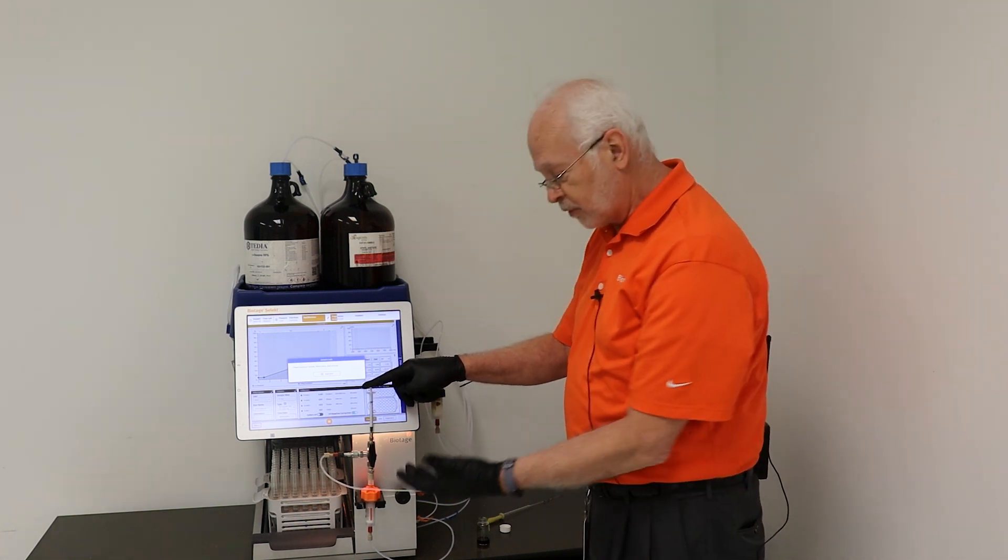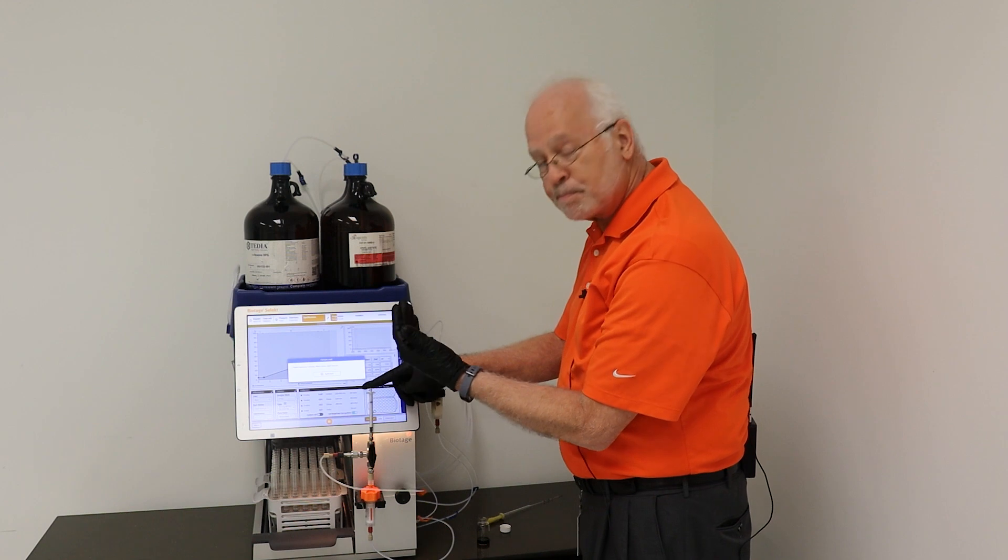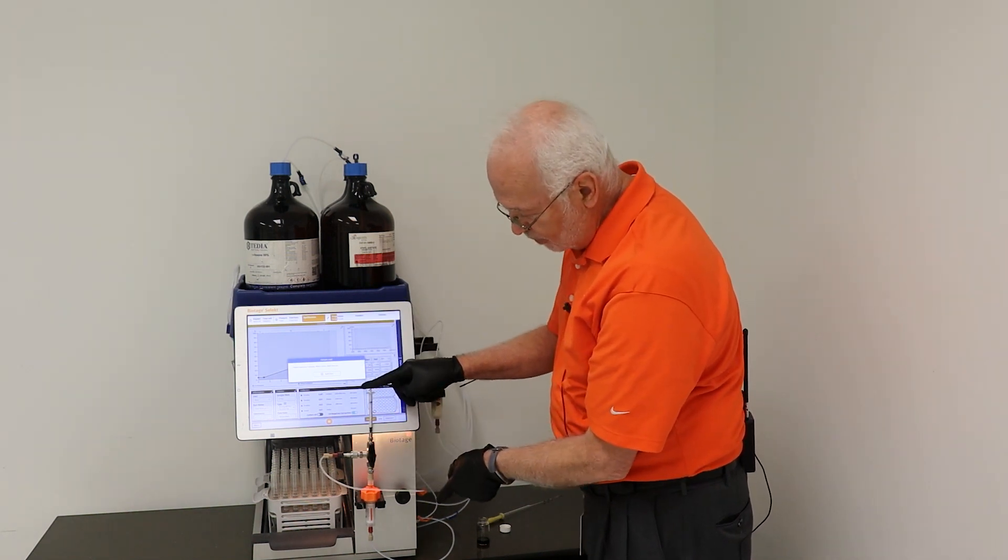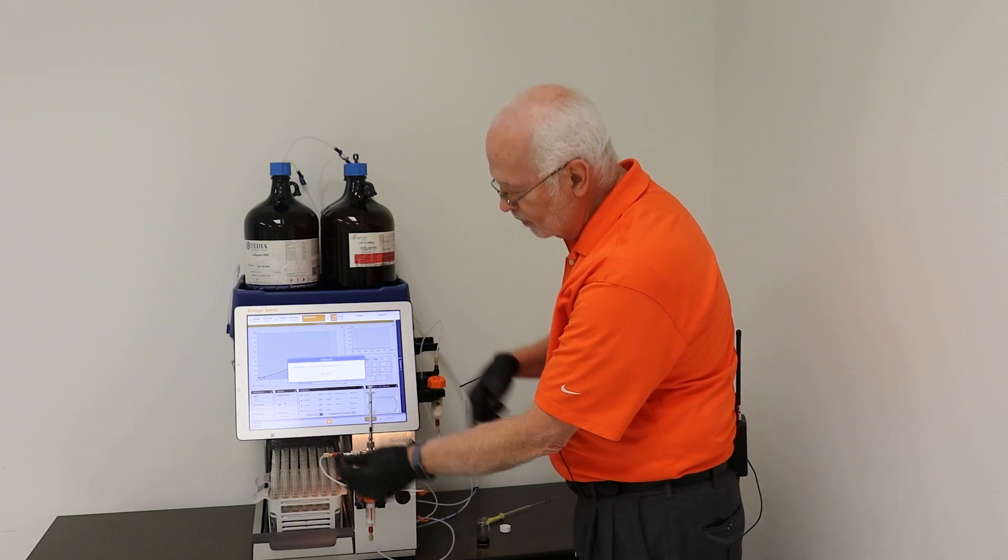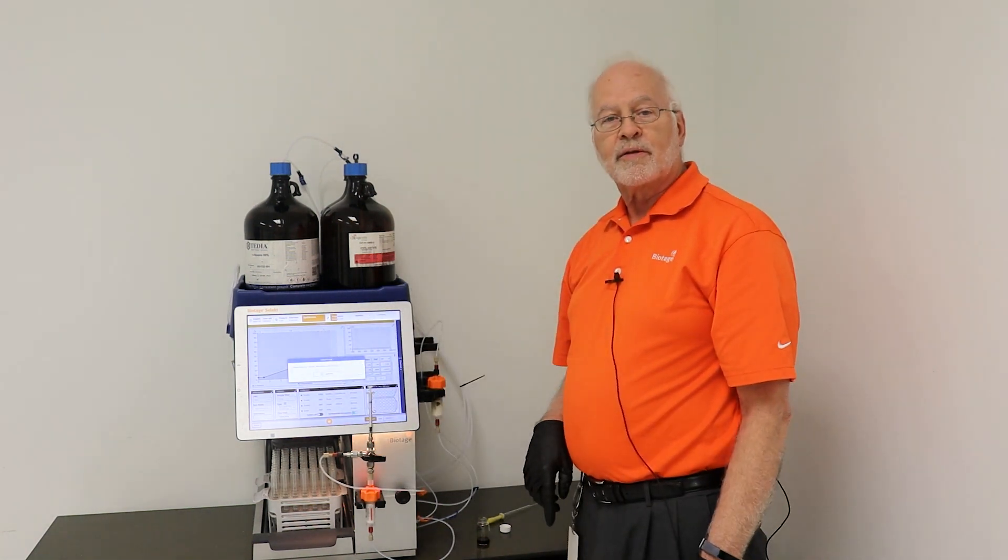What's nice is if your sample is going to have a tendency to blow back, once you've depressed the plunger you can turn the valve and then start your chromatography.